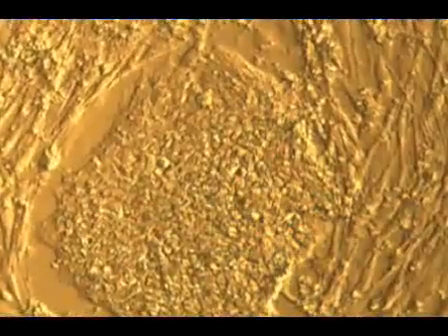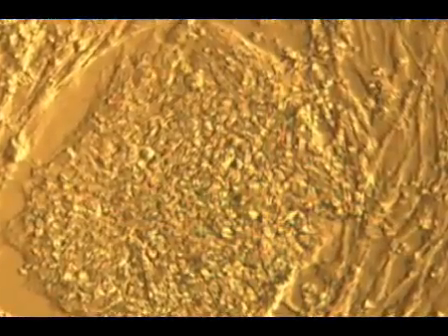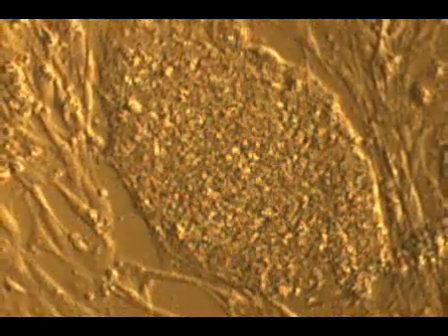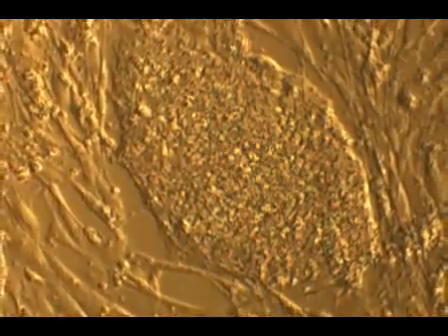Although human embryonic stem cells have been shown to present a stable diploid karyotype, many studies have reported that depending on culture conditions, they become prone to acquire chromosome anomalies such as addition of whole or parts of chromosomes.